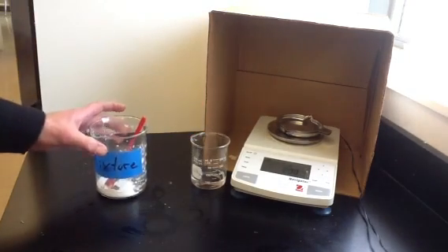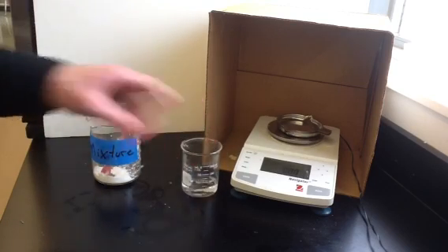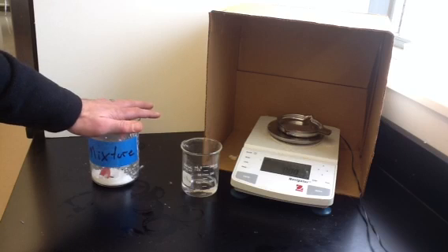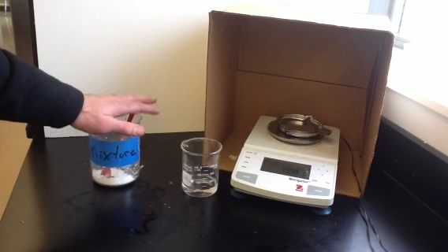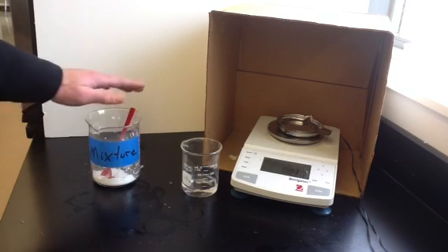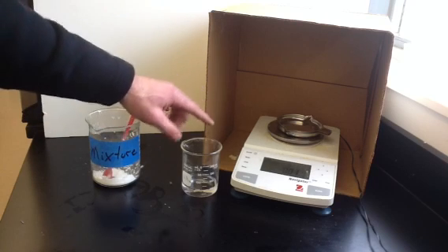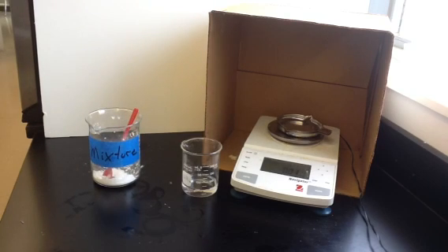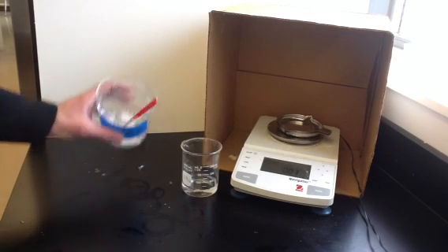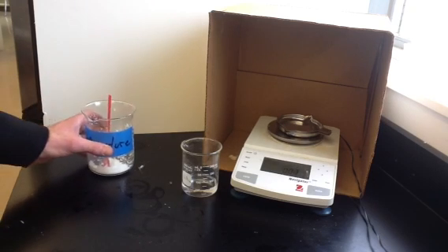So for this lab, we're going to take a sample of the mixture and react it with acetic acid. The sodium bicarbonate in this mixture will be turned into carbon dioxide, and the sucrose will not react at all. By figuring out how much carbon dioxide is released, we can use stoichiometry to figure out how much sodium bicarbonate was in the original sample, and we'll assume that the rest of it was sucrose.